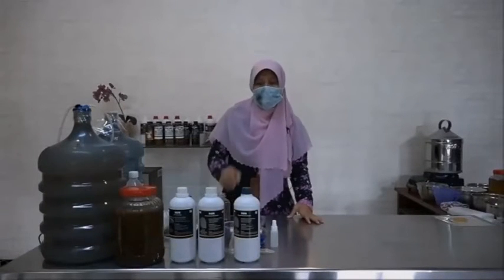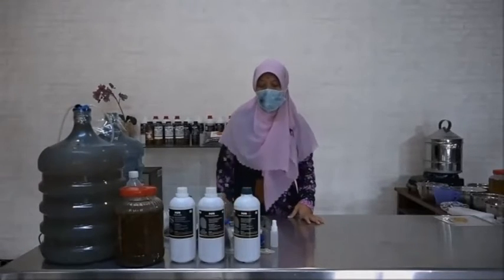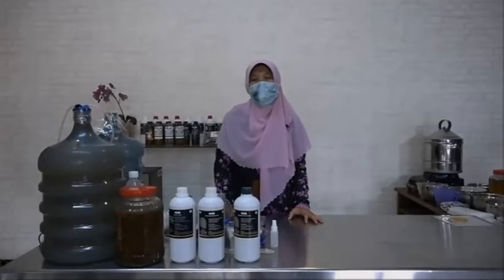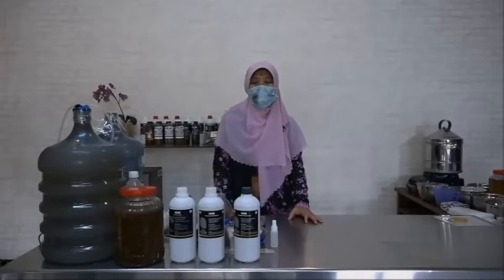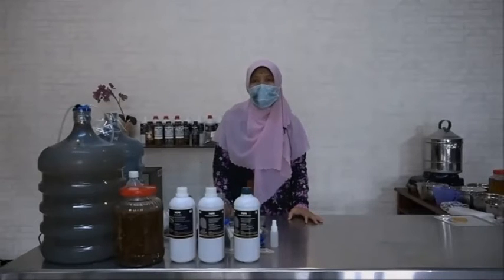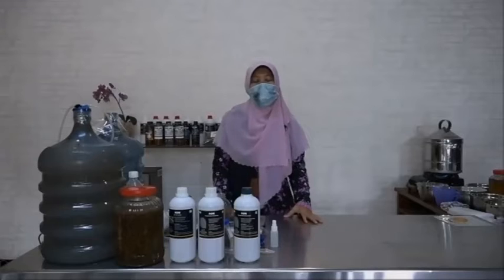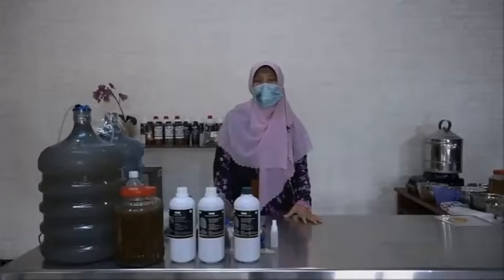And the second, if we use the pure isolate, we know the specific bacteria in there. We know the names one by one, for example, Pseudomonas fluorescens and Bacillus subtilis. And we know that these bacteria have been researched previously regarding their capability and mechanism for promoting plant growth, and they are beneficial for us.